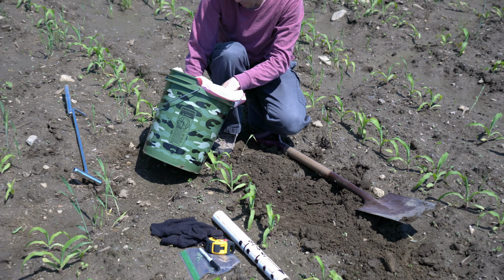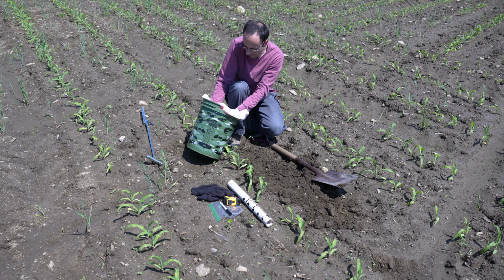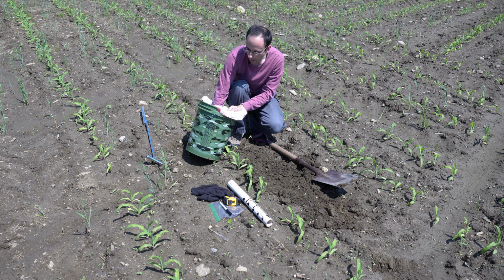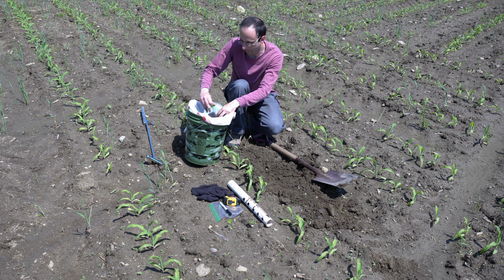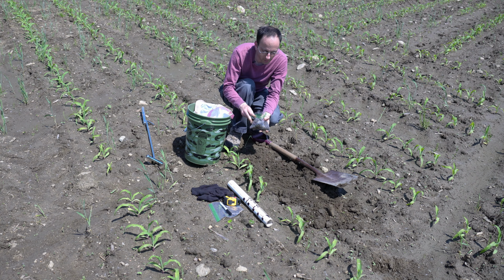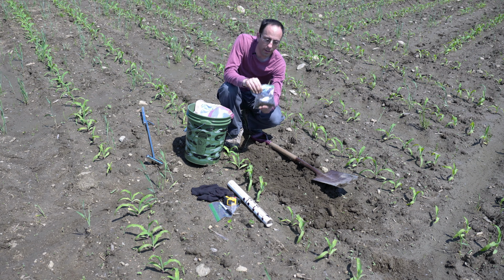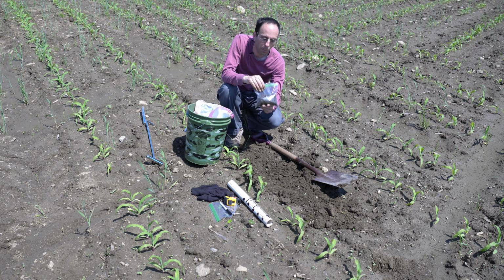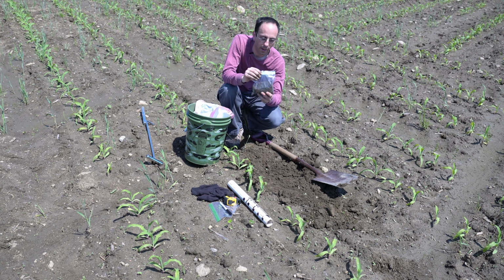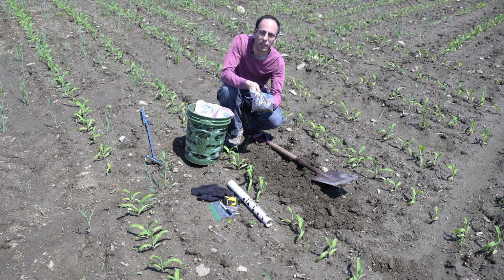When you get all the soil mixed up and nice and together, you want to remove anything large that you see in the soil. The lab will screen that out, but why send it to them if you know they're going to screen it out anyway? Visually, what this generally looks like is approximately this much. Label the bag, double bag it, and as always, when you're sending this, make sure you also include the appropriate paperwork. The lab will thank you, and it'll help you ensure that you're getting accurate results, and they know exactly who that soil belongs to and where the results need to go.